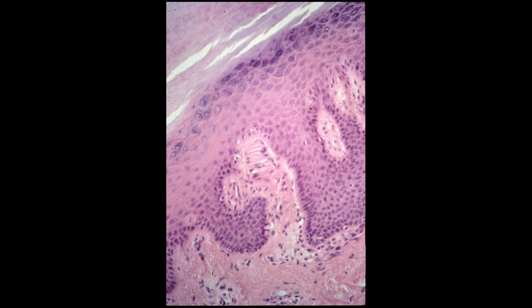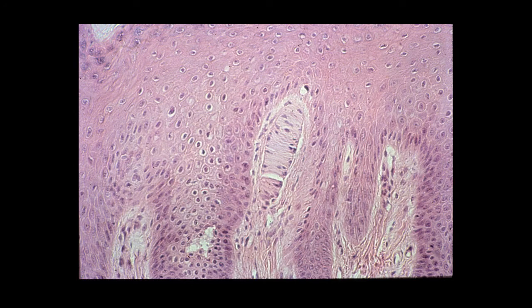These touch receptors consist of axons, perhaps of 1 to 4 different types of afferent nerves that are not visible, but these nerves are surrounded by an elaborate club-shaped capsule which is composed of fibroblasts and flat epithelial-like cells. And nuclei of these cells tend to be located horizontally. The axons, once they enter this capsule, lose the myelin sheath, and they're going to branch extensively and interdigitate processes among the epithelial-like cells. And this is just a little bit higher magnification of the Meissner's corpuscles.